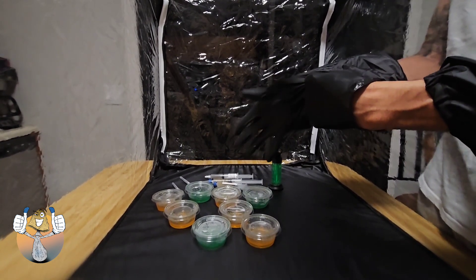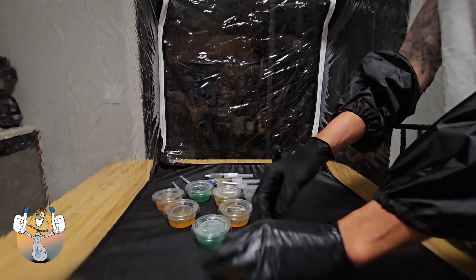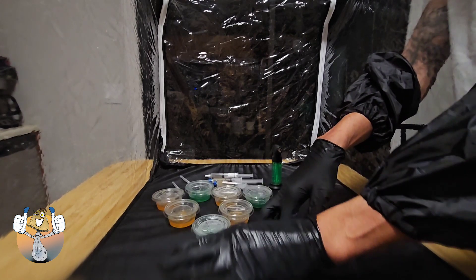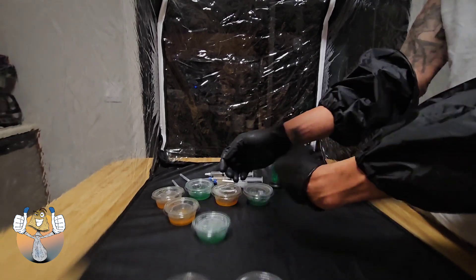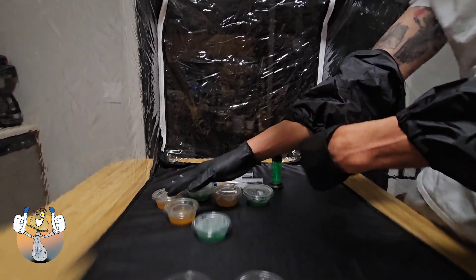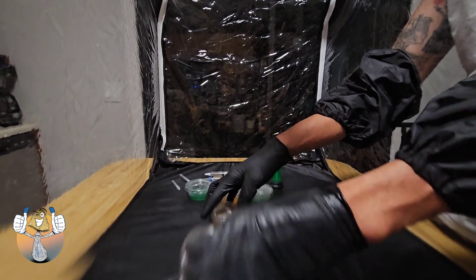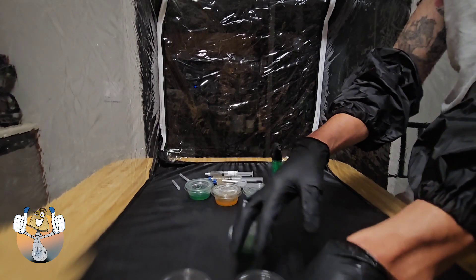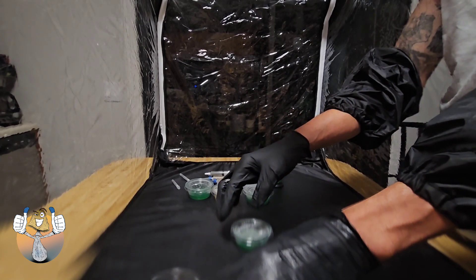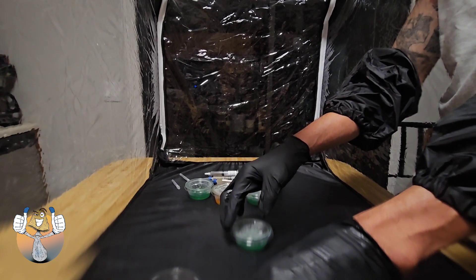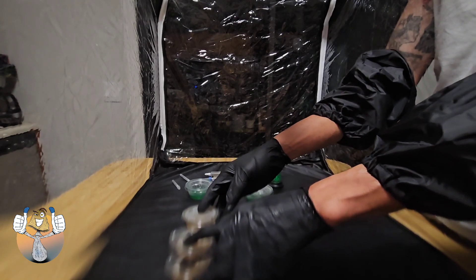Okay, so I'm going to go ahead and set this area up real quick and we're going to get to it. Now, mind you, everything is already prepped and cleaned with the 70 percent iso alcohol. I prepped and cleaned the still air box and let it sit for about 35 minutes before I started. Washed my hands and isoed my arms and gloves.